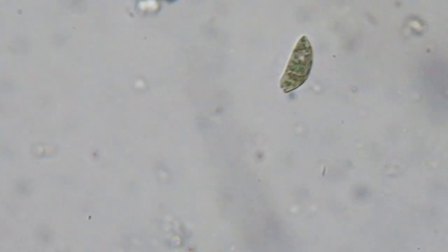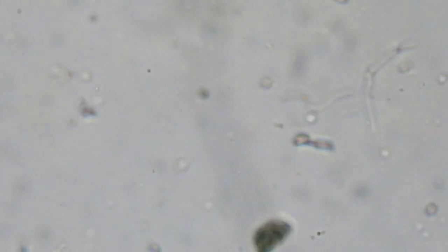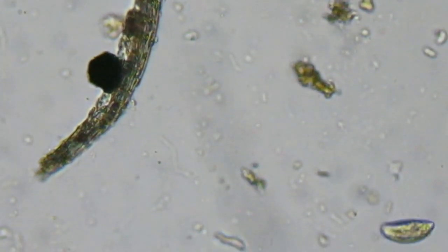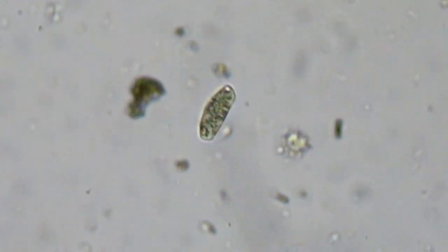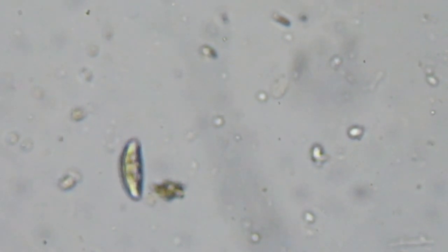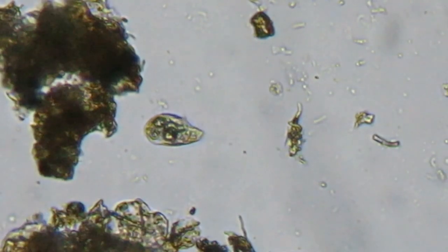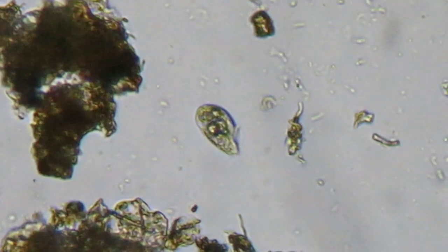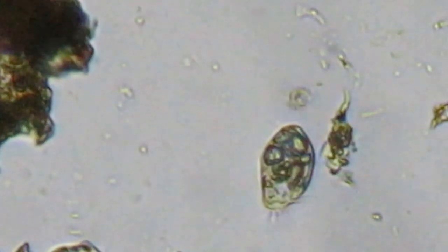And another protist here — this one is a paramecium. I'm not sure of the species; I think it's caudatum but I can't see the contractile vacuoles. You can see that they are actually pretty quick when they move. You have to follow with the focus because with the moss under the cover slip it's basically like they're swimming in a giant ocean — they can swim in all directions and your depth of field is really shallow. I think we're gonna get in a little closer.